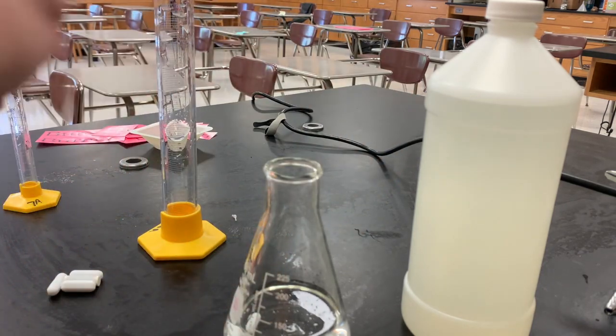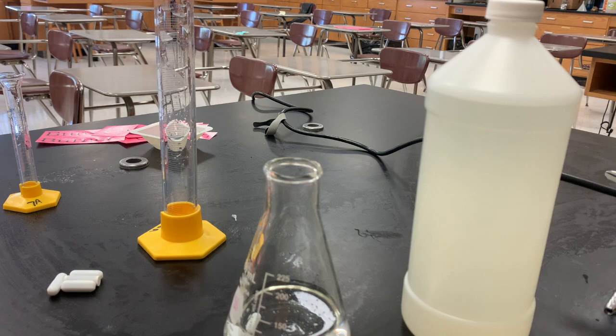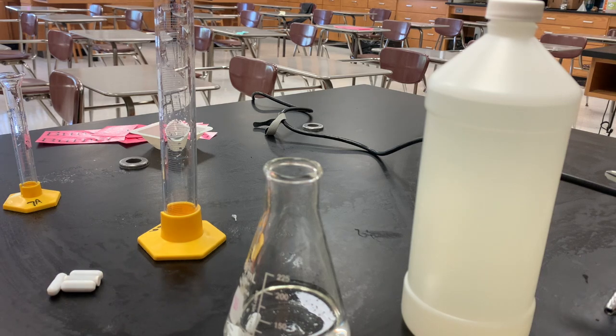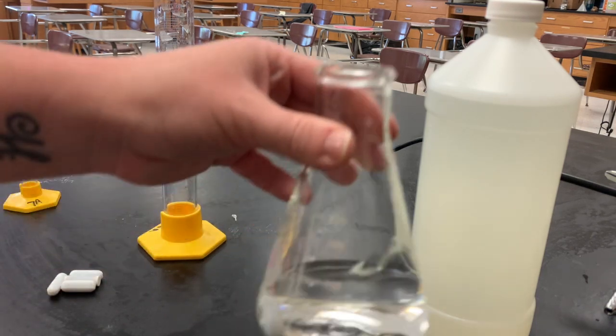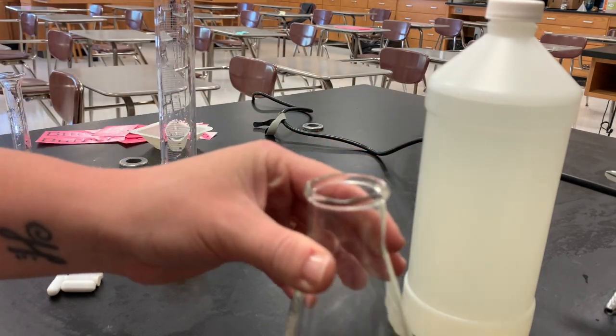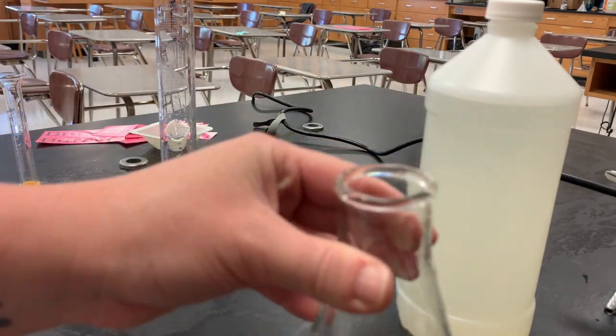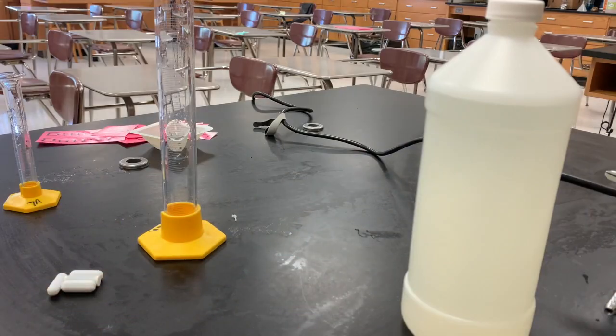It is more of a base indicator, because as you can tell, I added this to an acidic solution and nothing happened — it's still clear. So that means we should see a pretty cool color change as we add in NaOH.